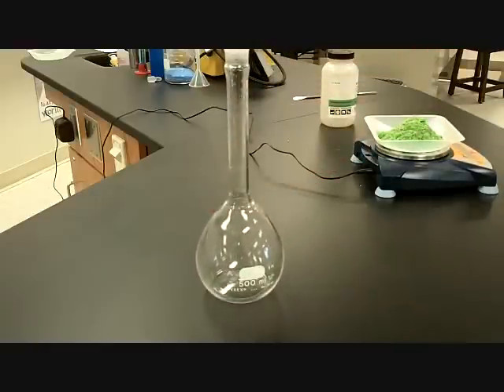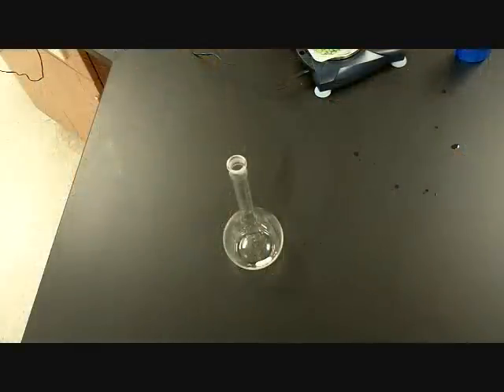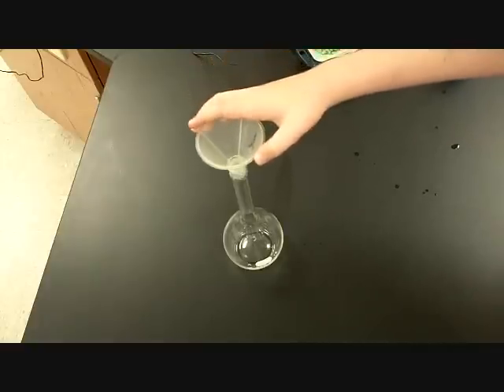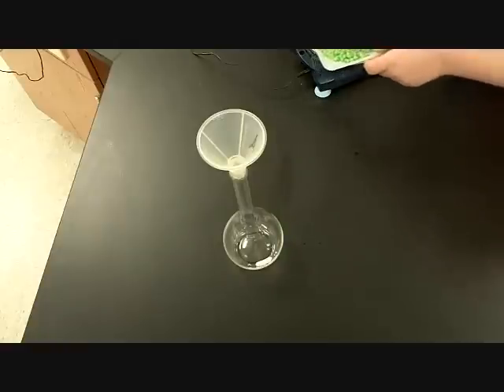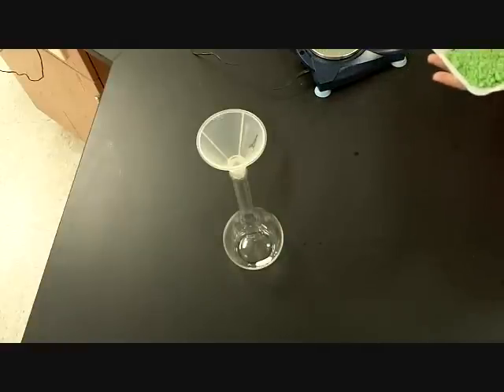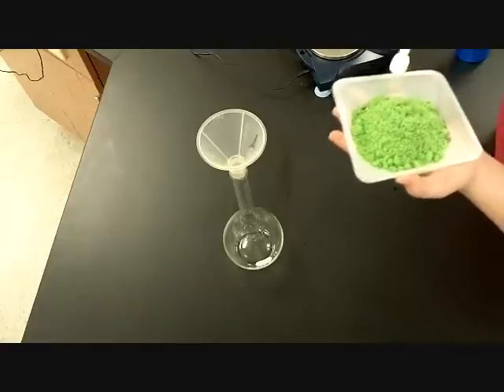So now we're going to take our 97.19 grams of the nickel 2 chloride and place it in our volumetric. But we have to do this a little at a time since that is a lot of nickel 2 chloride and we don't have a very large opening. So let's go ahead and use our funnel for this one. Go ahead and put a little bit at a time. Hold that carefully, like a bread basket. There you go. Use your spatula. Add a little bit at a time without spilling any.